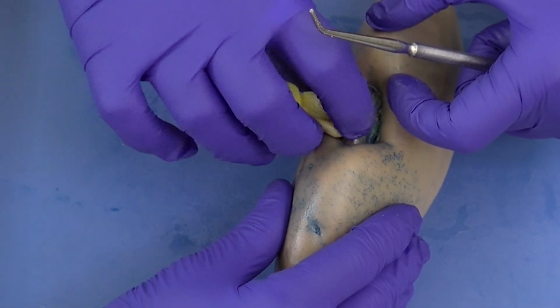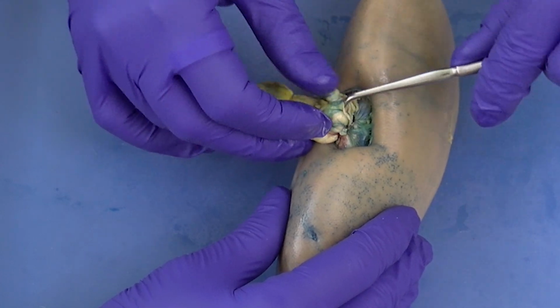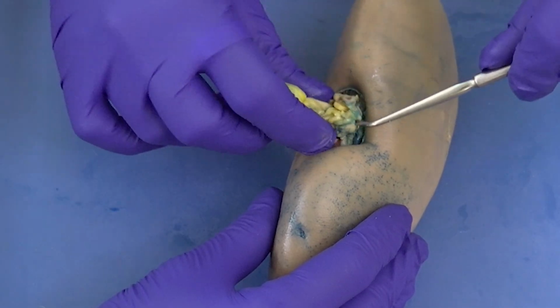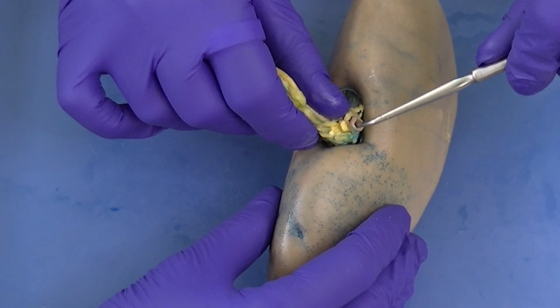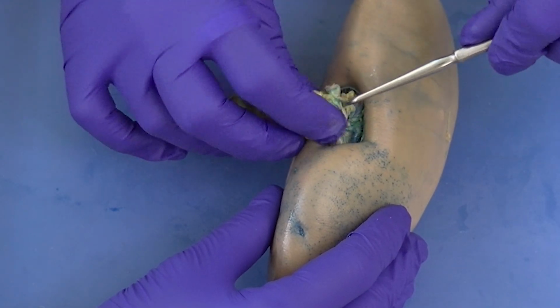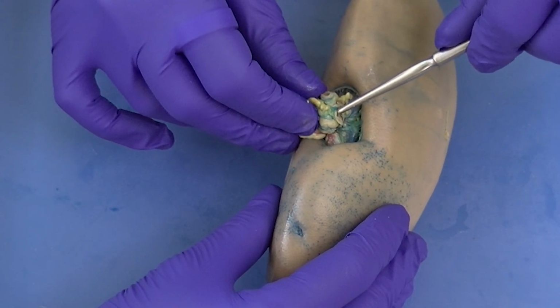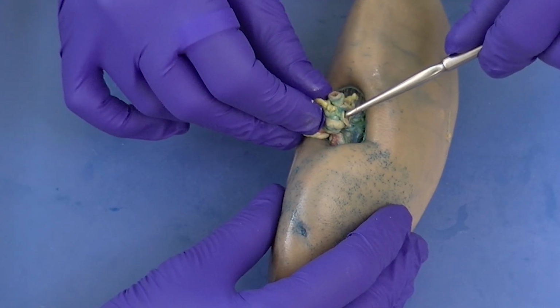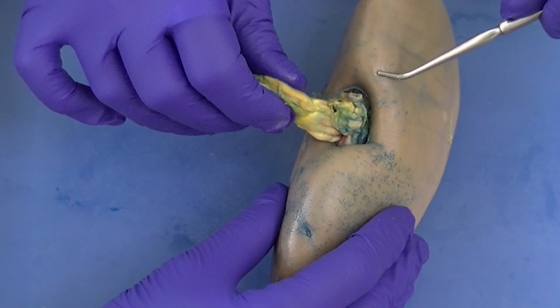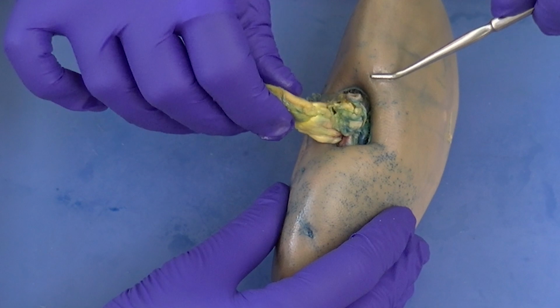You're going to find the vein is much harder to locate because it does indeed collapse when there is no blood present. And so this is what we're seeing right here. You see this opening where my probe is, but we didn't recognize that as easily because, again, the strong musculature of the artery is what kept that nice and open for us. Here, the vein has collapsed a little bit, but it is still findable. If we were to have fluid here, this would reform and make a nice round lumen for us once again. So this is the hilum, and these are the three structures, two that are outbound, the ureter and the renal vein, and one that is inbound, the renal artery.